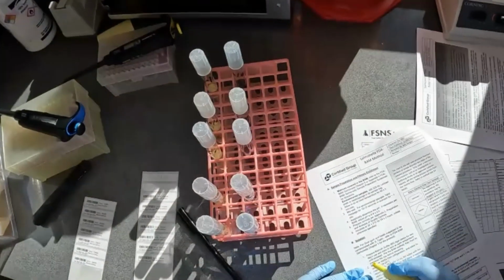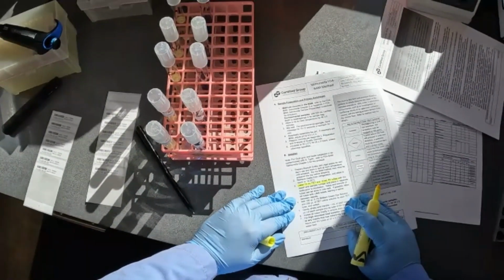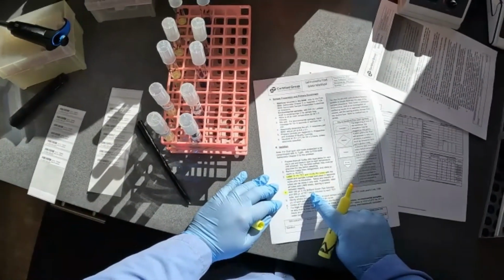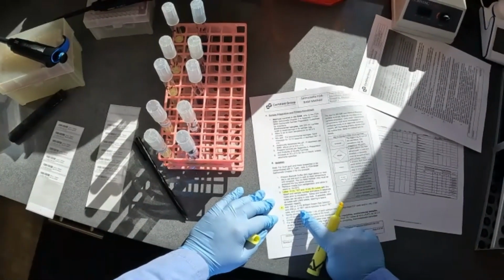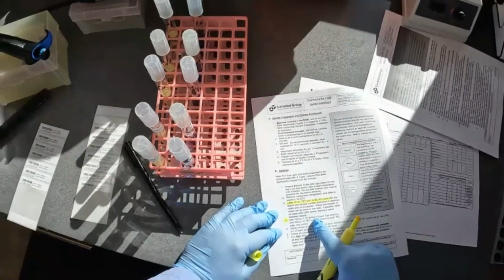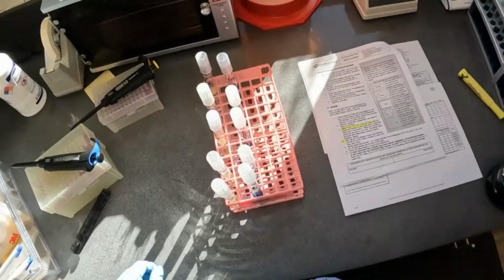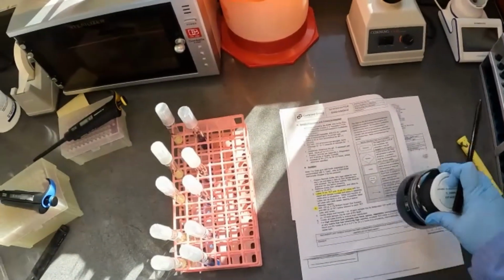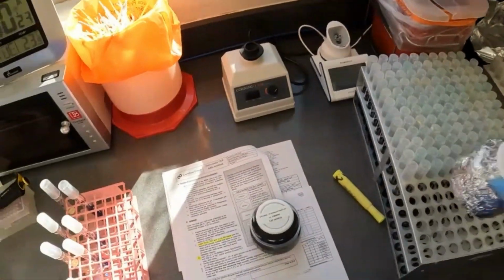Okay, so we labeled our 10 mil TET and RV tubes. And now we're going to complete our additives. So we're going to add 100 microliters of brilliant green dye solution at 0.1%. We're going to add 200 microliters of the TET iodine solution to each tube and vortex. So both the brilliant green dye solution and the TET iodine are both going to go into this tube. So now we're going to add the 100 microliters of the brilliant green dye solution, which is right here, and 200 microliters of the TET iodine solution, which is right here.